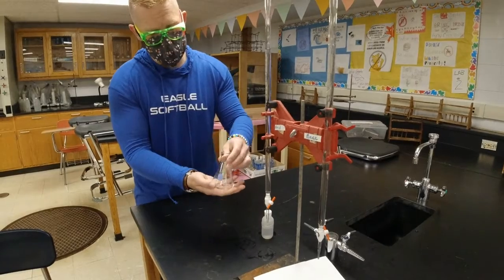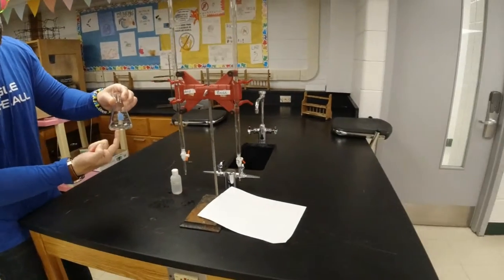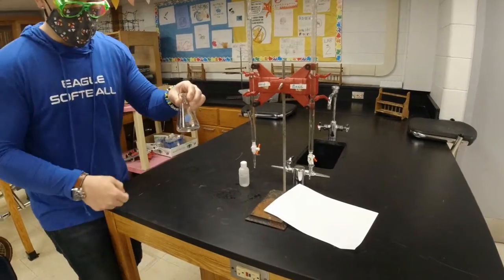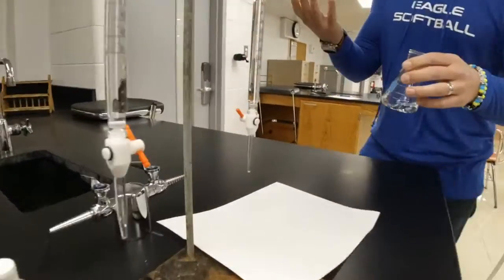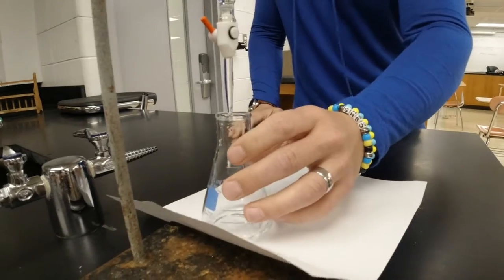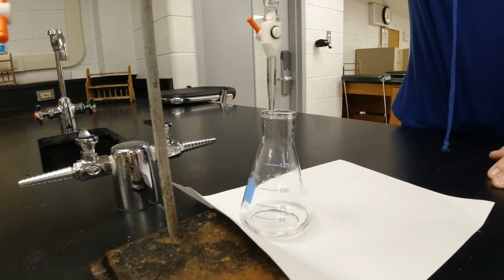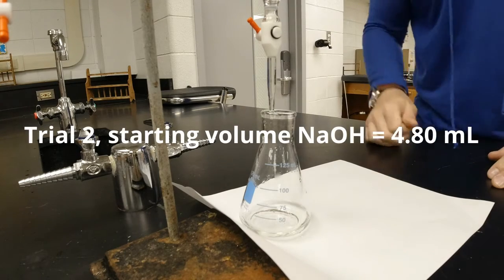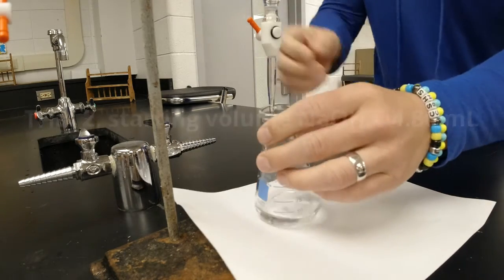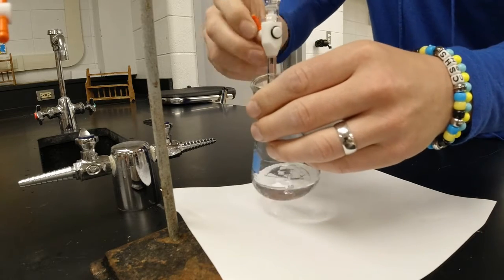That's the rumor. All right, so now that I have my acid and my phenolphthalein, every time it touches base, we should get a nice little pink color. So the question is, how much base is it going to take? So right now, I'm looking at starting at 4.8 milliliters. So I'm going to start adding it drop by drop. And to begin with, I'm going to do a quick twist.